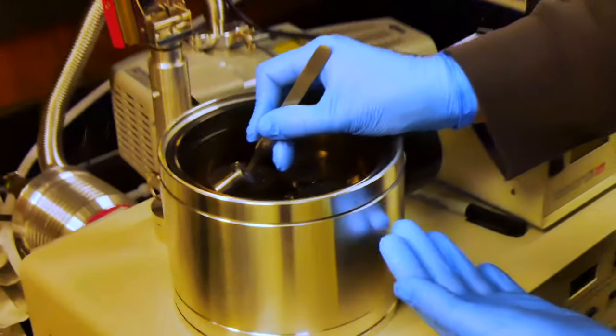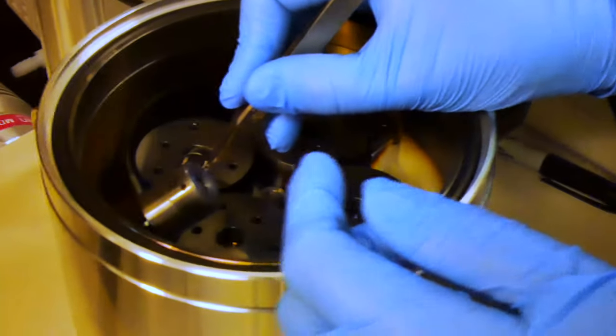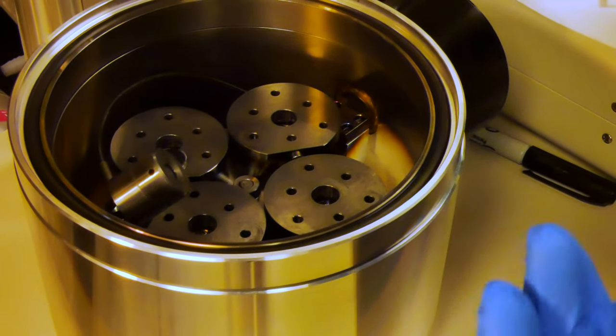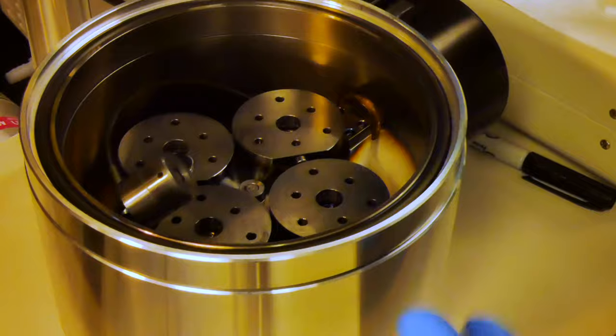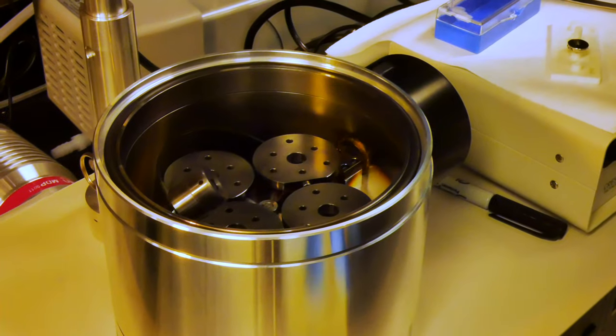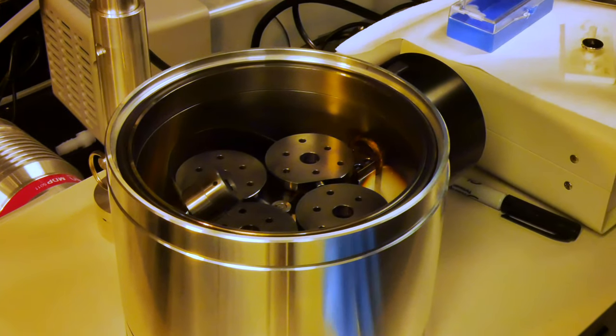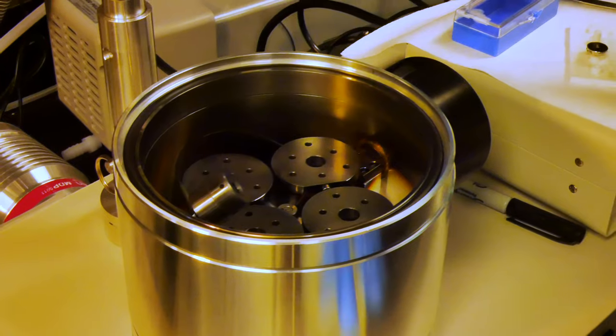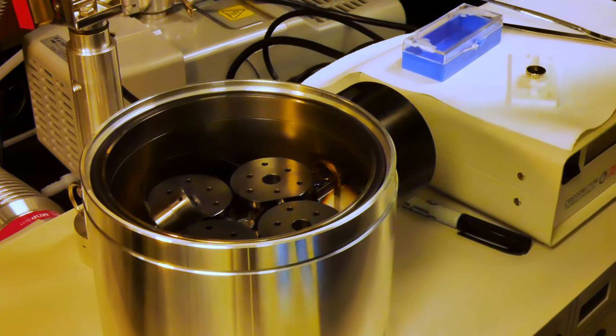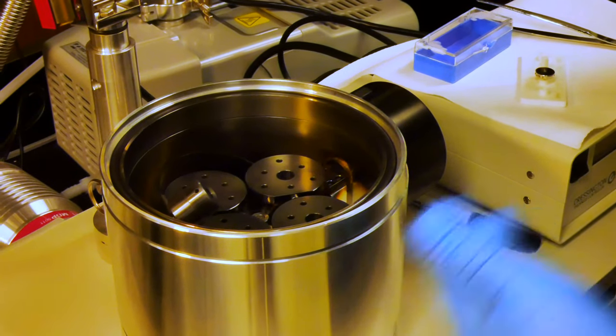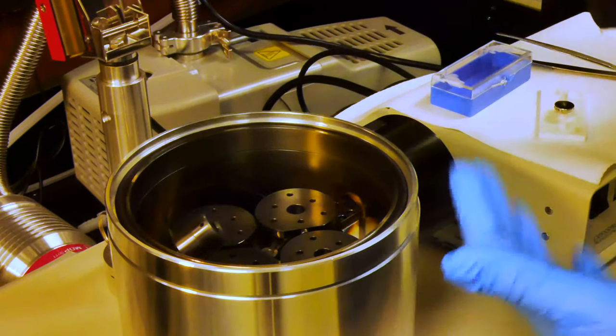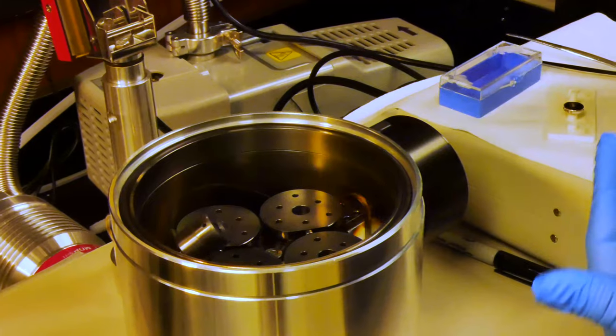We'll very carefully load these onto the sample holder. In the bottom of this unit, there's actually an open hole. So dropping something into the bottom of the chamber is very dangerous. If that should occur, please contact Kathleen or myself and we will assist you in retrieving the sample. It may require a bit of disassembly and it may prohibit us from sputtering on that particular day. However, if that dropped sample were to remain, it would cause the pump to be destroyed.